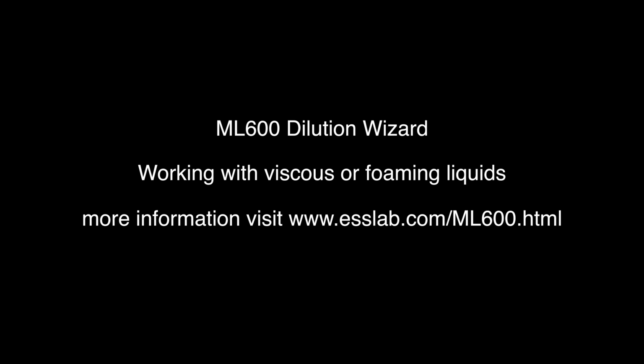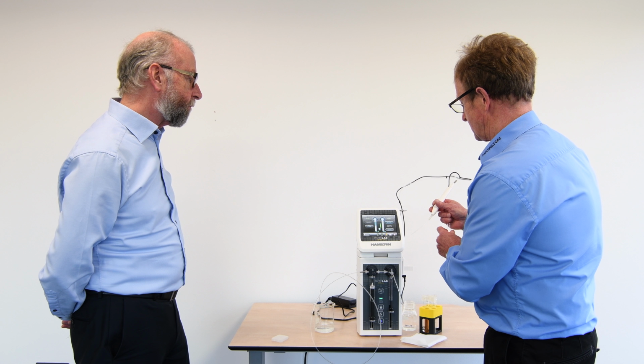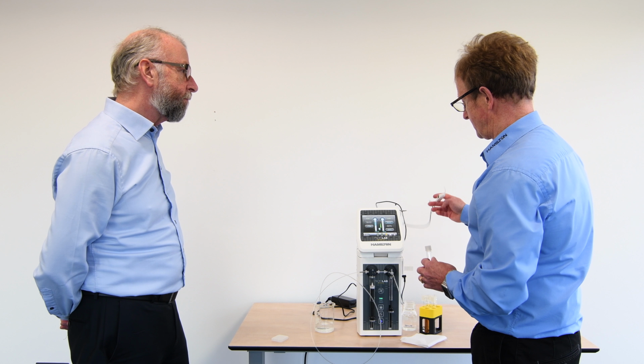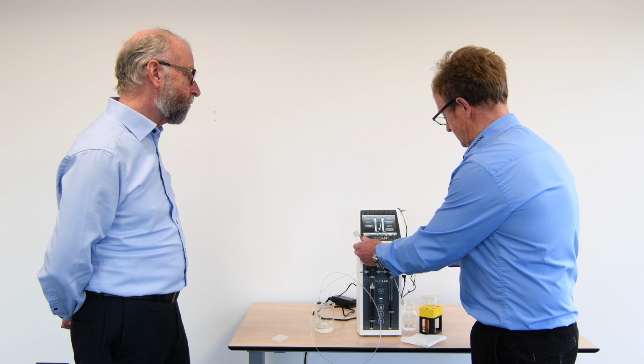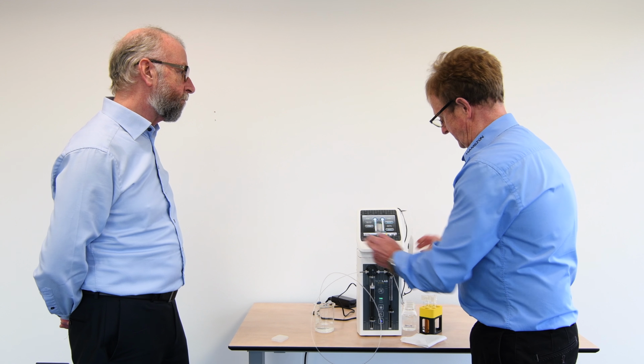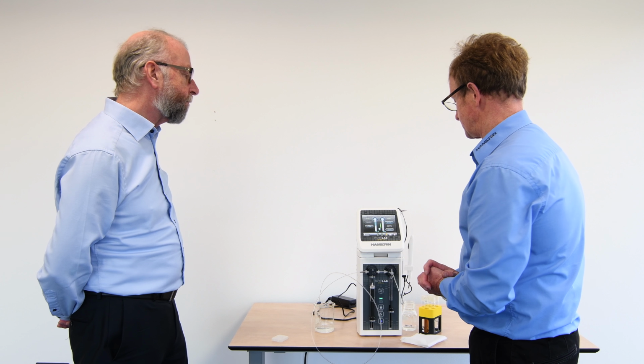And what you'll see now is the speed of the drives is significantly lower, thus preventing any foaming or indeed aerosoling of the sample. So there is complete control over the rates at which the system is aspirating the reagents and also the sample, to ensure that we get the highest level of performance and efficiency from the system. Yeah, very good.